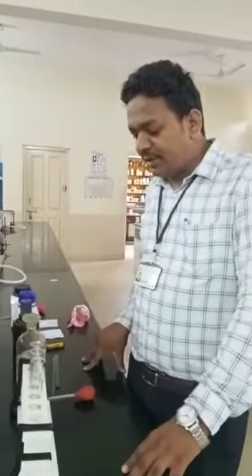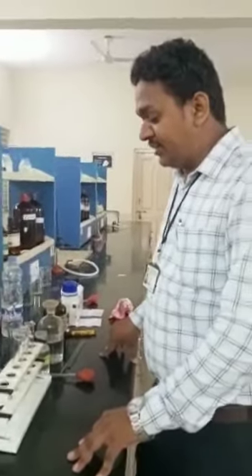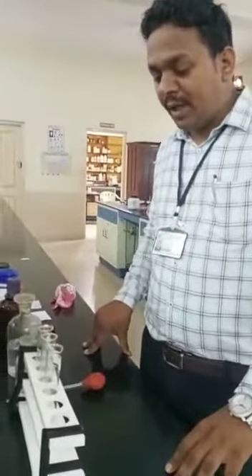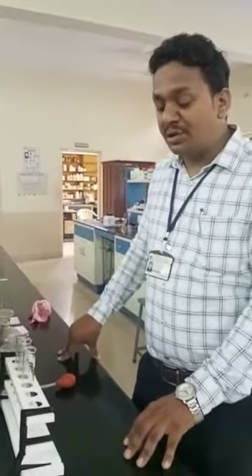Good morning, dear students. In the previous video, we studied the theory part of the limit test for chloride: the principle, aim, apparatus, and procedure. Today, I will demonstrate the limit test for chloride.